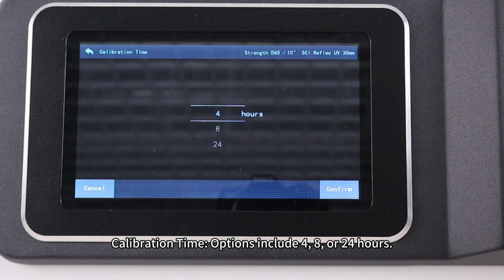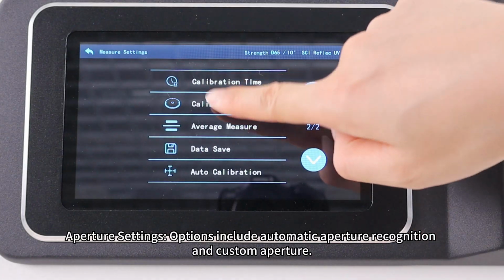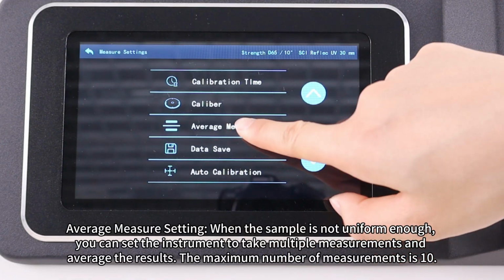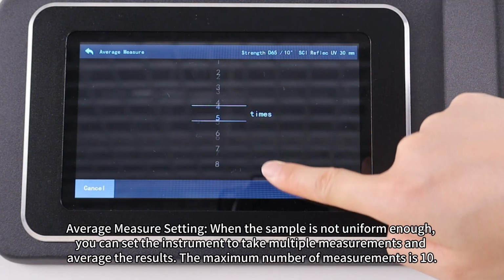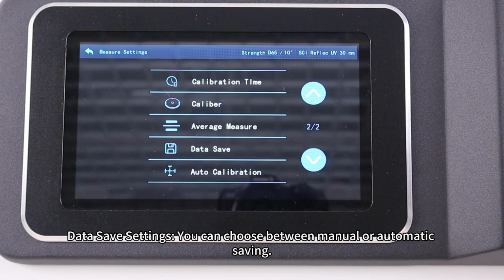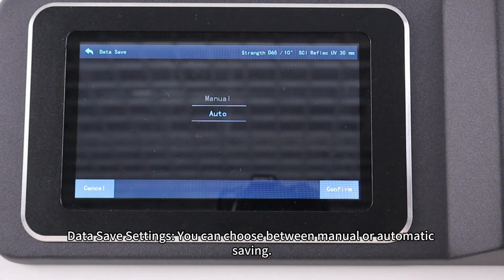Calibration time. Options include 4, 8, or 24 hours. Aperture Settings. Options include automatic aperture recognition and custom aperture. Average Measure Settings. When the sample is not uniform enough, you can set the instrument to take multiple measurements and average the results. The maximum number of measurements is 10. Data Saving Settings. You can choose between manual or automatic saving.